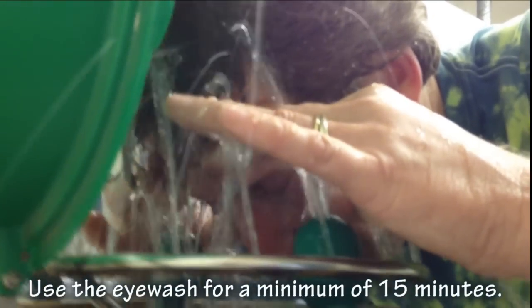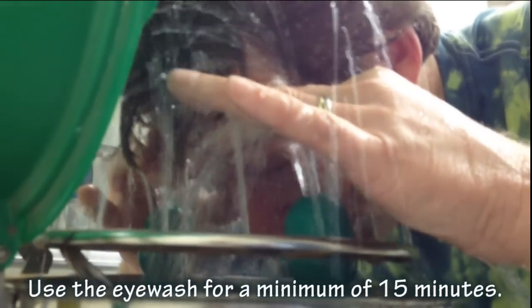Ahhhh, it's cold! I know it's cold, but you gotta do it for 15 minutes. How long? 15 minutes! No way! Yeah! No!